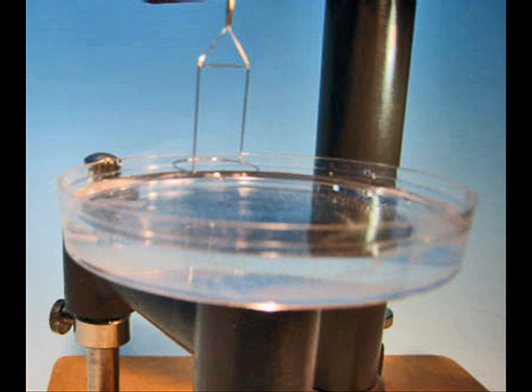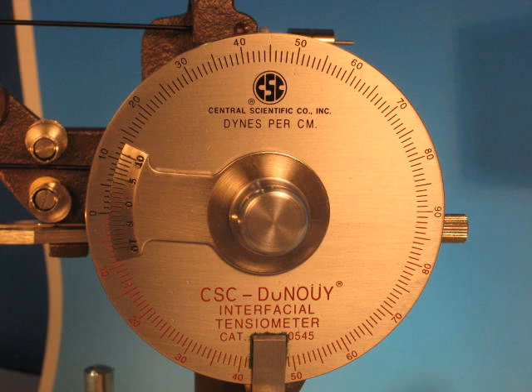The process is repeated until the ring pops up and the pointer moves above the mirror line. This signals the end of the test process.